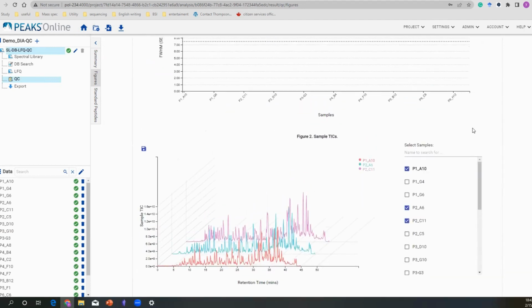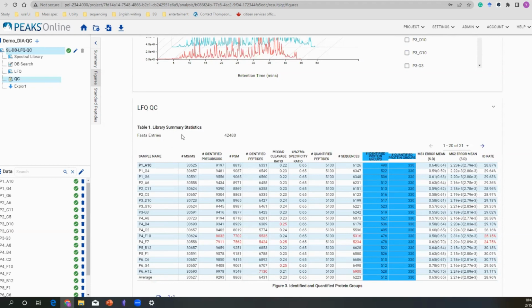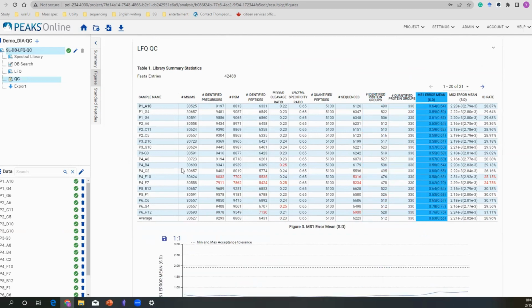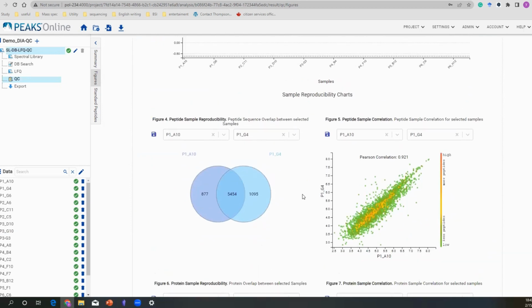This part is the end of our LC-MS part, and in here we are focusing more on the library search or database search. Besides what you may have seen before, the MS2 numbers and precursor numbers, we are seeing some PSM numbers, identified peptides, quantified peptides, MS errors, and your ID rate. Again, they can all be plotted into this line chart here. And at the end, you can see the reproducibility of your samples.